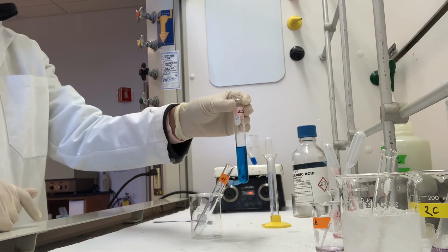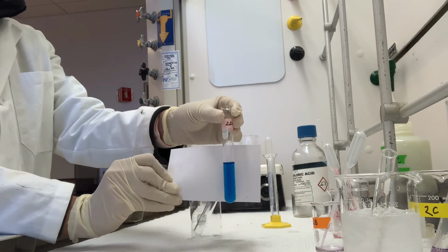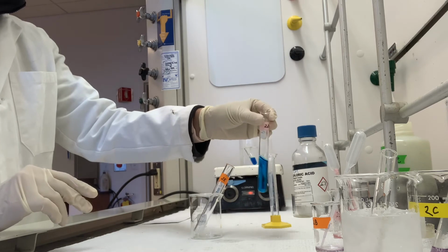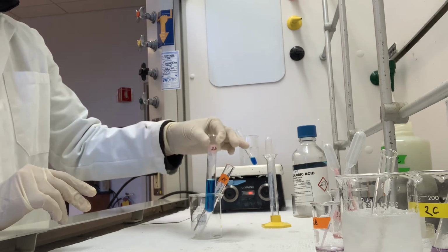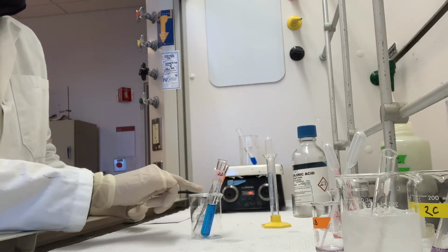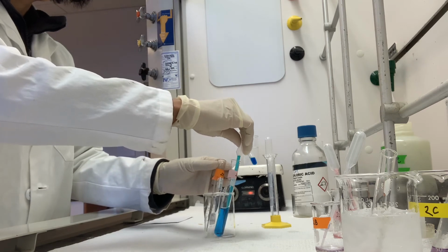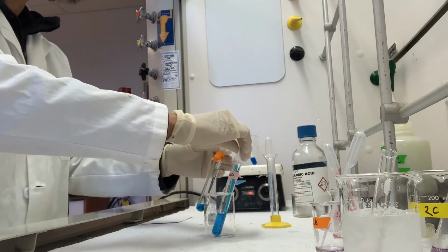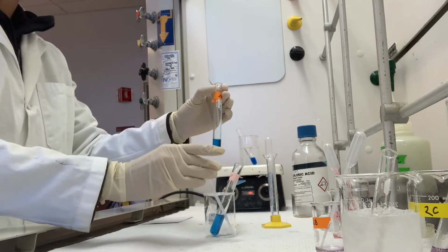So here we have it. This is step 2D. Hold the index card up against it. Okay. Just give it a quick shake to make sure there's some uniform mixing in there. And then we are taking 2 milliliters of this into our final condition 2E. Alright, so this is step 2E at this point.